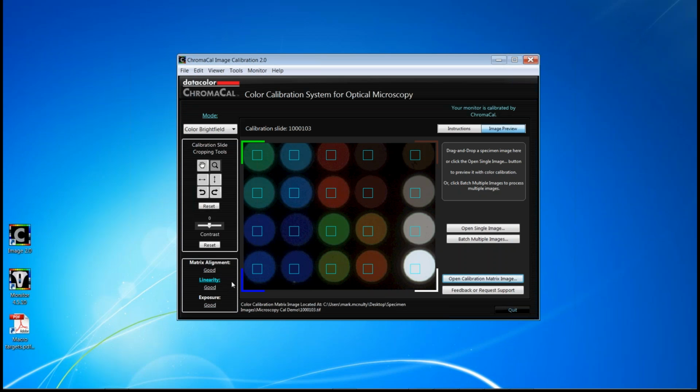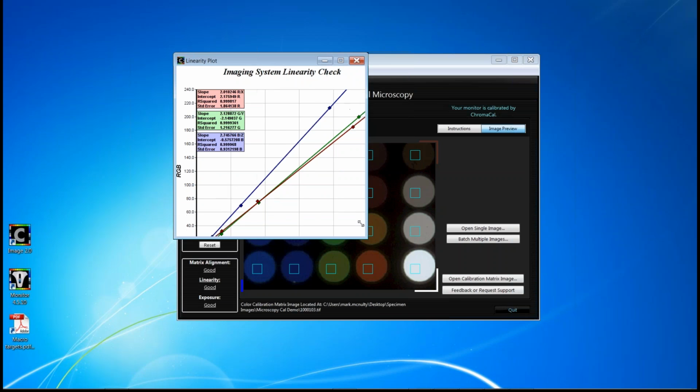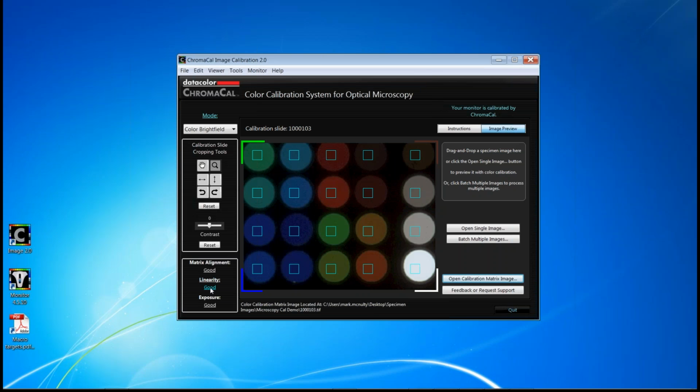One of the recent features that we added was the ability to hyperlink, by clicking that linearity text, to the linearity plot. This plot is now also resizable, but basically it's a representation of the red, green, and blue channels and whether they're falling across, obviously, a straight line. So there are regression numbers in here to give you the degree of compliance, or you can simply rely on the linearity result, in this case being good. The two that will allow you to proceed are good or within tolerance.